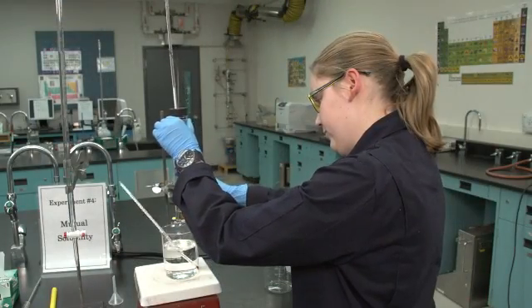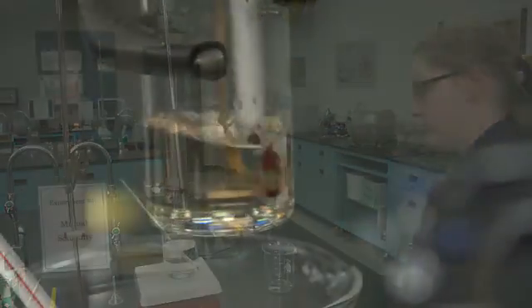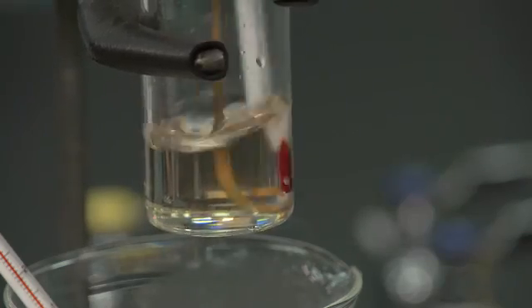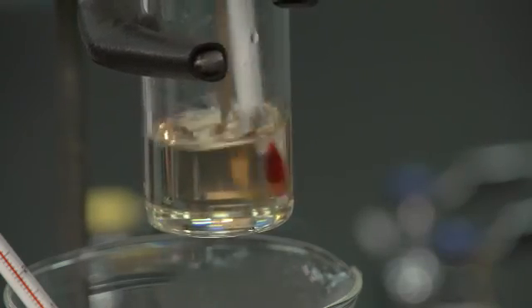Remove the tube from the hot water bath, stirring the liquid as it cools. As soon as the solution changes from clear to cloudy, read and record the temperature again.